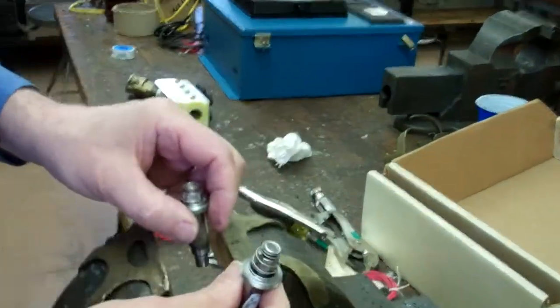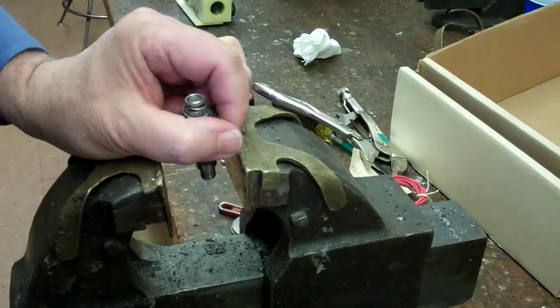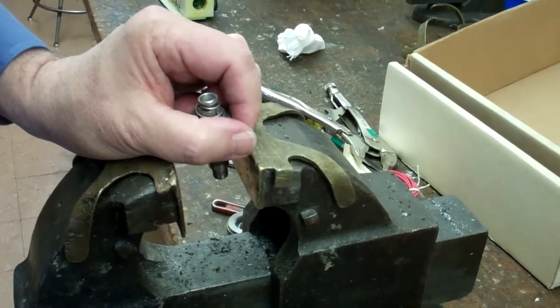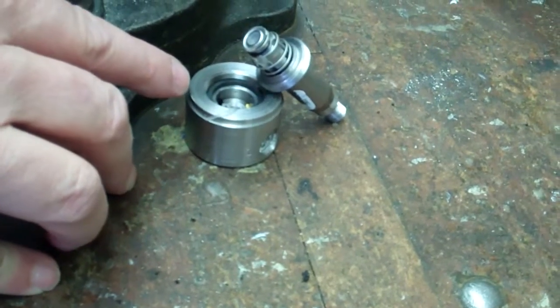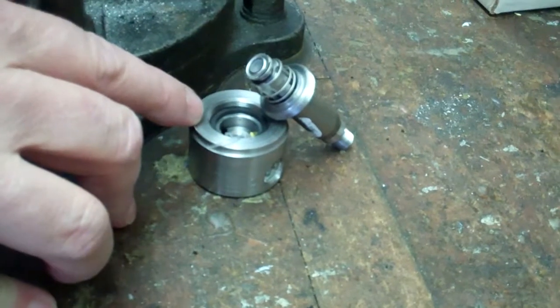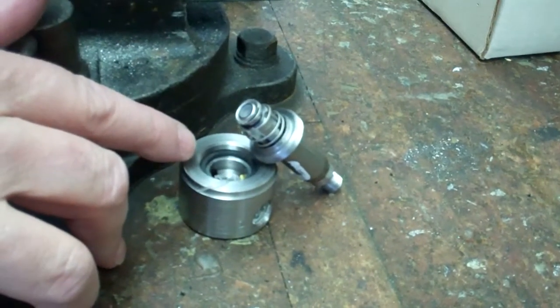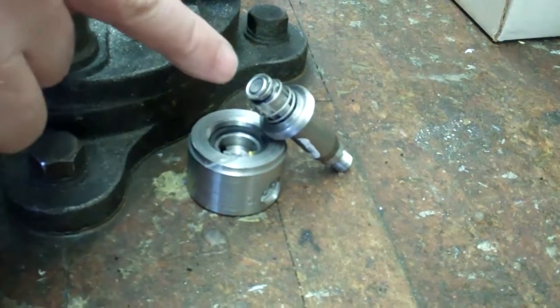My suspicion is somewhere during installation something got in this valve. And these various pieces of evidence indicate that's a likely probability. We don't know. I haven't seen this come in the valves from Skinner, Honeywell, who makes these valves. I've never seen this issue before.